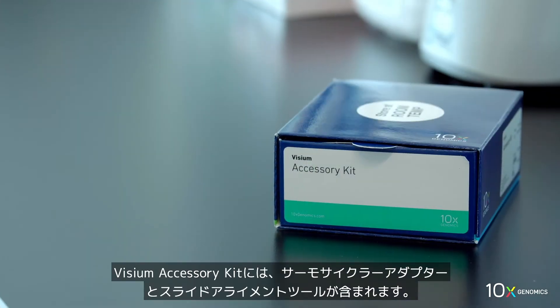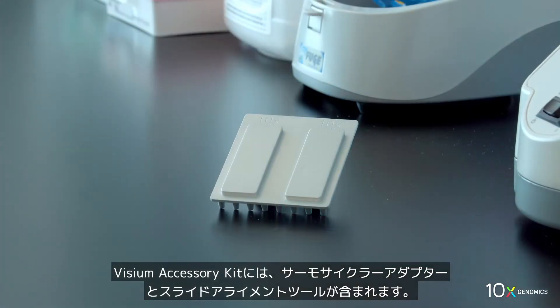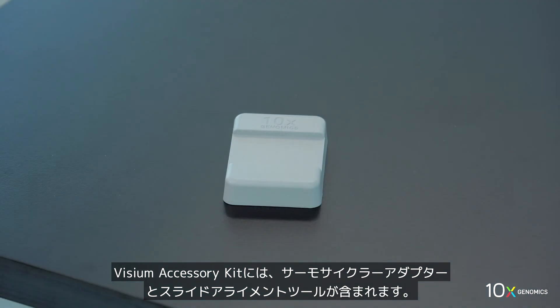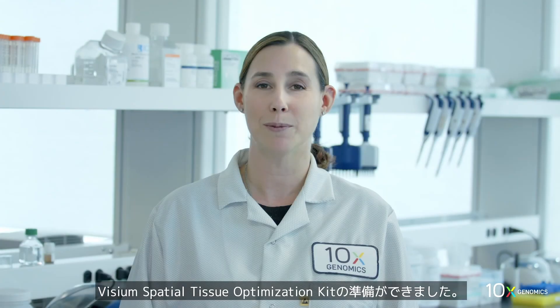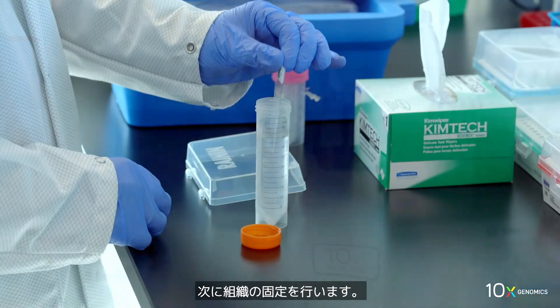The Visium accessory kit includes a thermocycler adapter and a slide alignment tool. The Visium spatial tissue optimization kits are ready.